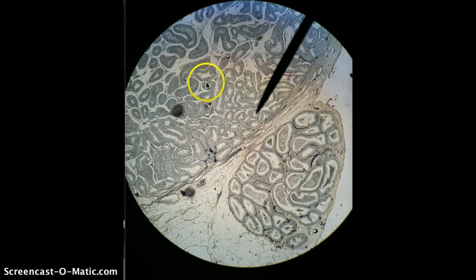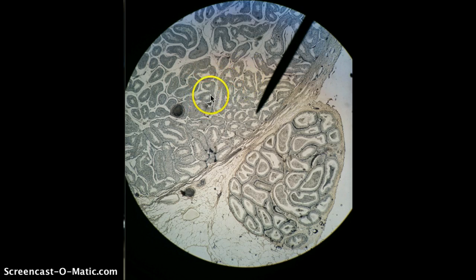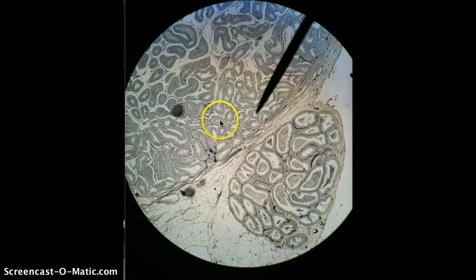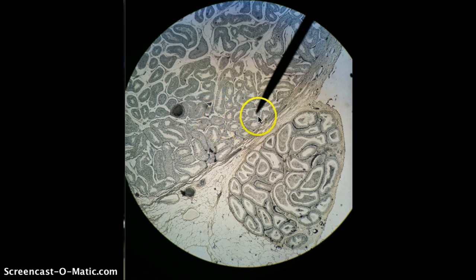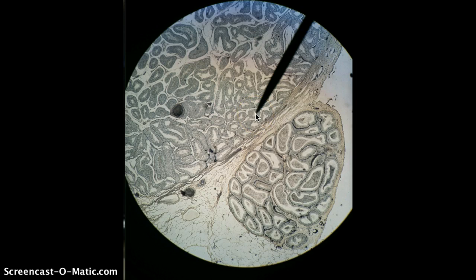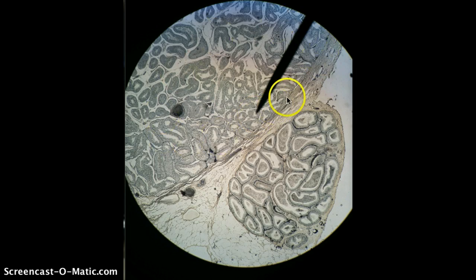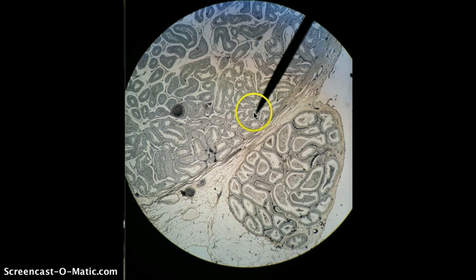Each one of these circular structures here is a cross-section of a seminiferous tubule. The pointer is asking: what structure is this? Seminiferous tubule. So the pointer is on which organ? Testicle. What structure? Seminiferous tubule.